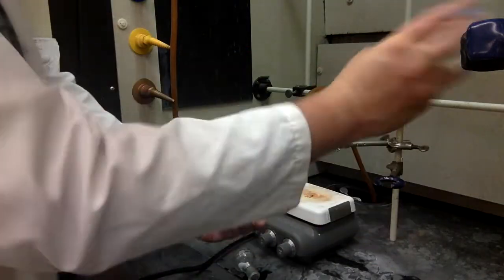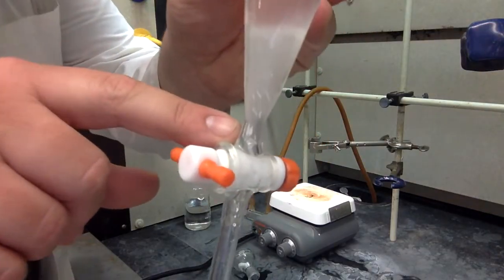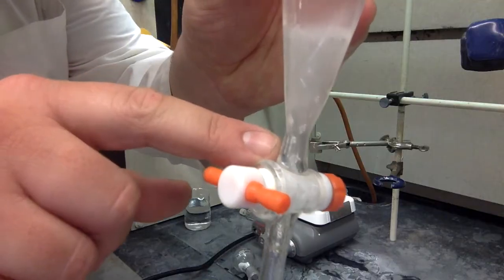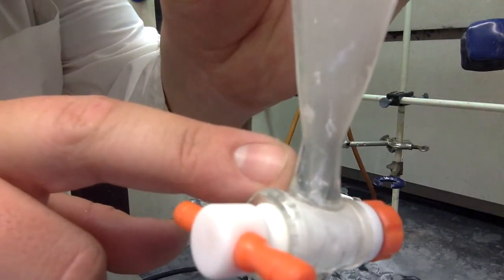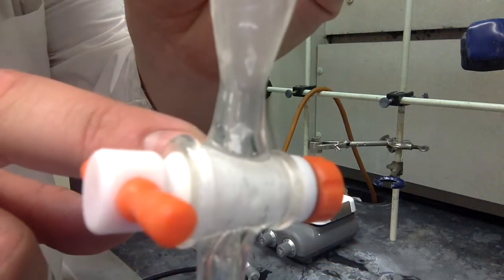Shake it around, let some gas out, shake it around, let some gas out. Eventually, you'll be done. But you'll notice that there's still a little bit of bubbling that's happening. Look at those bubbles. Let me get a little bit closer. Yeah, do you see those bubbles? What are those bubbles? You want to figure that out. What are those bubbles?